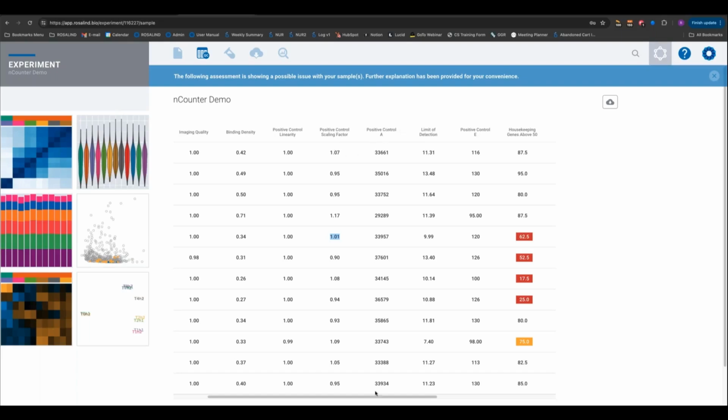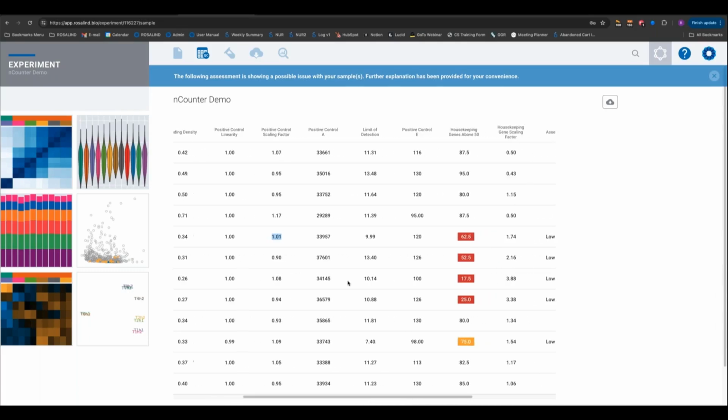Then we can look at positive control A. Again, this is going to be used to look at, what is that natural variation across the data set? This ranges from about 30,000 to, yeah, they're all in the 30,000s, maybe as low as 29,000. Not too much variation that I can see by my eye. As a reality check here, we can again look back at our positive control scaling factor. If any of these values were flagged, that would indicate there's probably too much variation in the positive controls, and we should take a look at that.